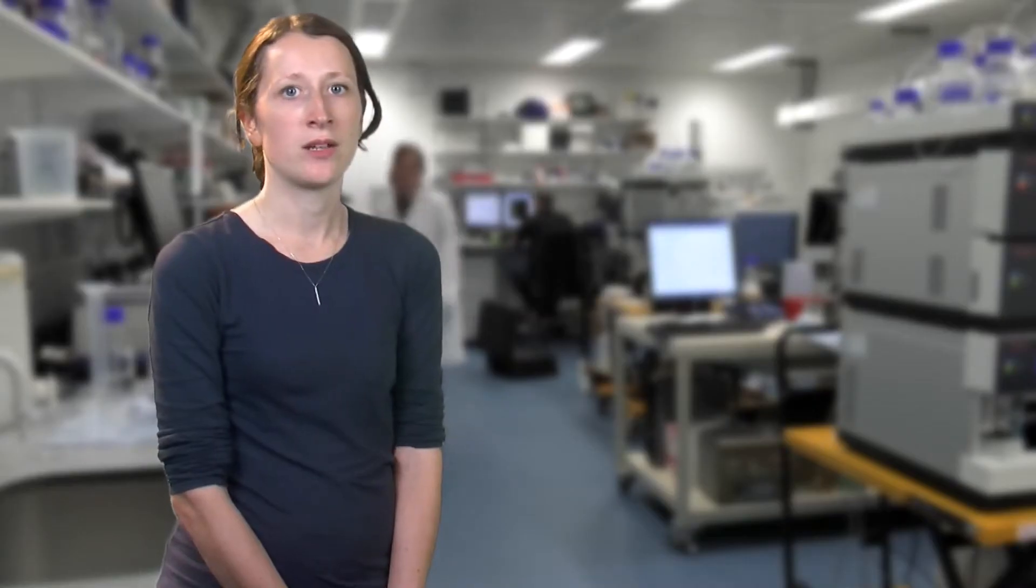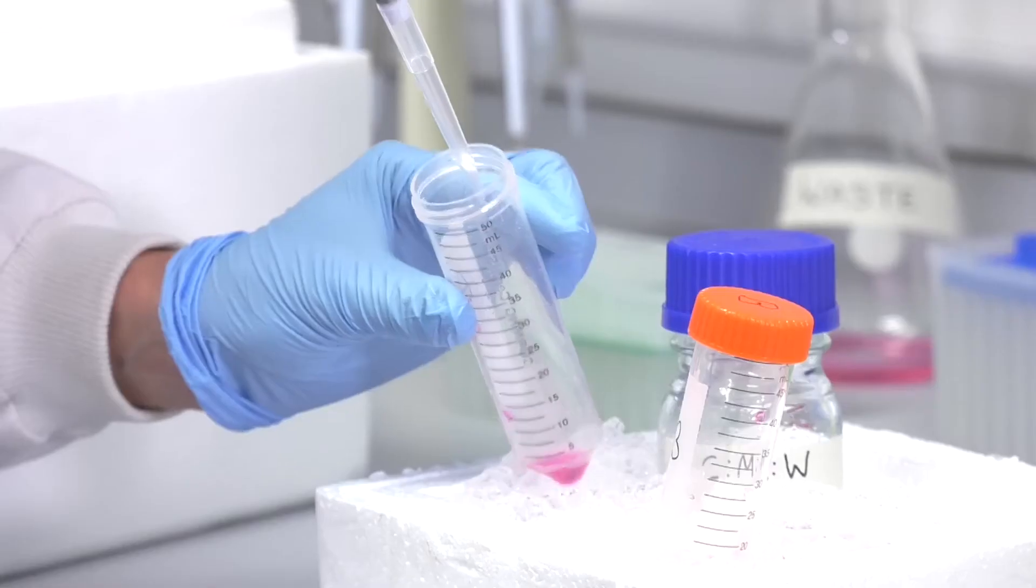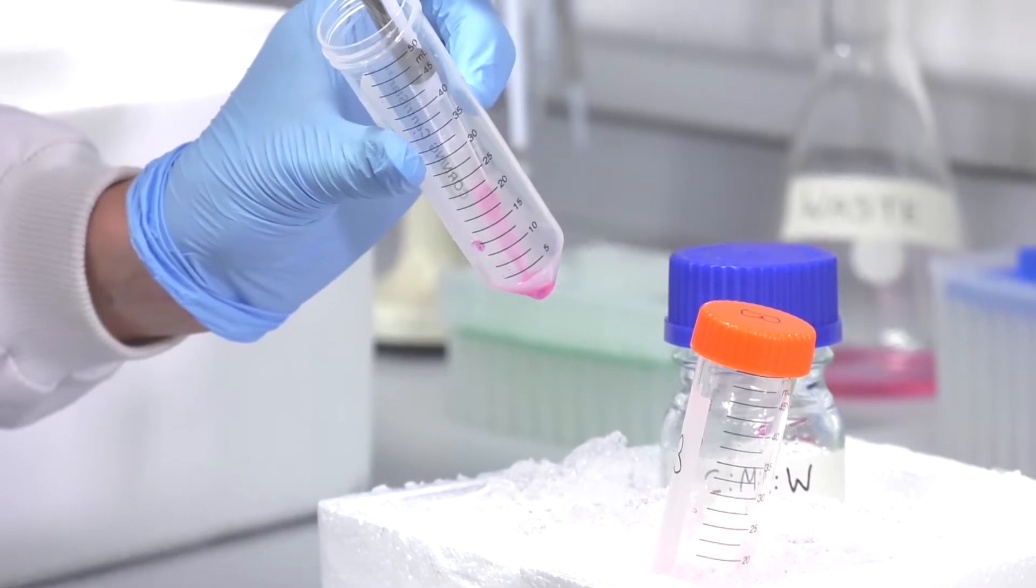Step 3. Transfer the pellet in a small volume of liquid to an Eppendorf tube. For bacteria, you may normalize the cell number here by optical density.